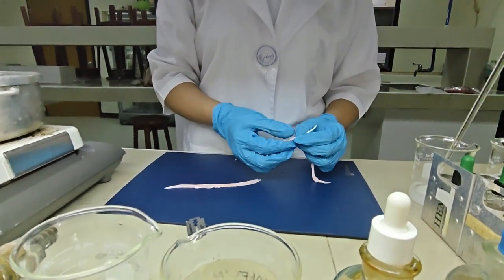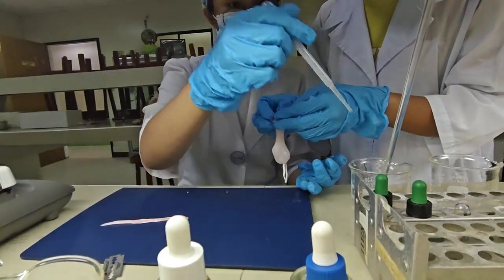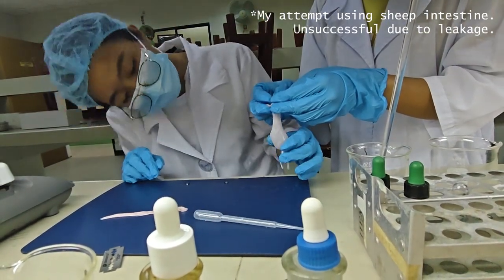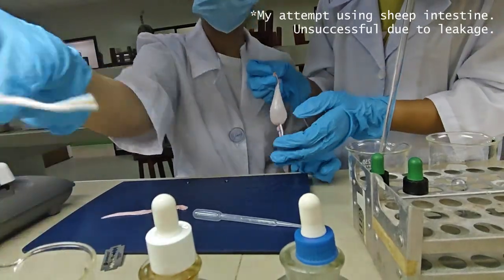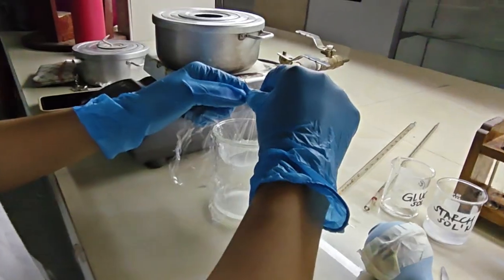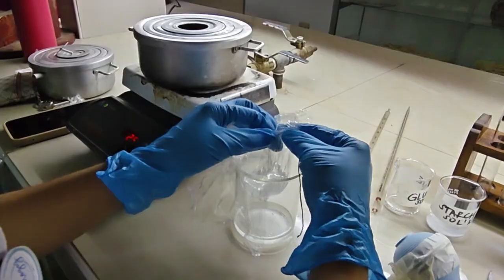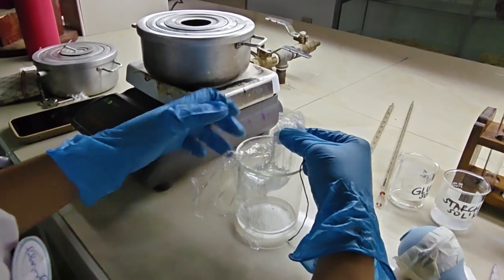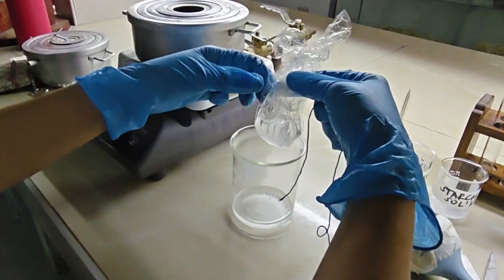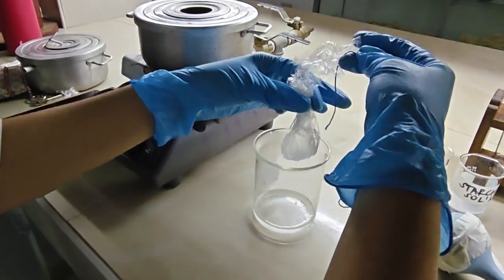Unfortunately, we weren't able to purchase any dialysis tubing from the local pharmacies and medical supply stores, and the hospitals or dialysis centers here didn't have any to sell. As a result, I improvised and used vegetable cling film instead. This is a viable alternative due to the presence of small pores in the plastic which allow molecules between 0.01 to 10 nanometers in size to pass through. However, this change should be noted as it significantly affects the expected results.